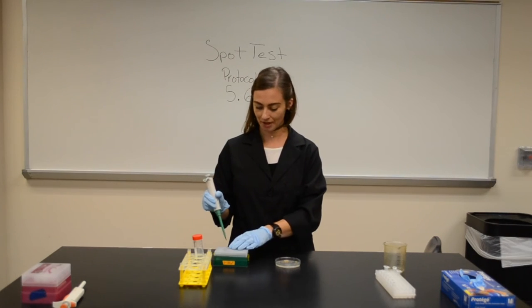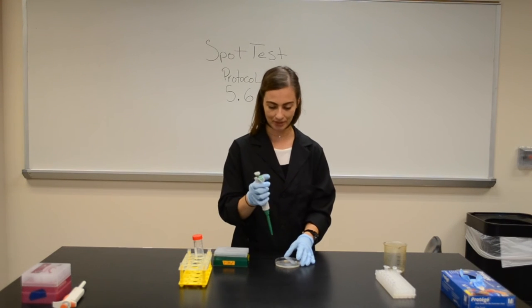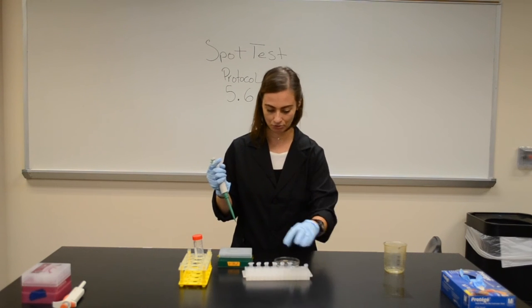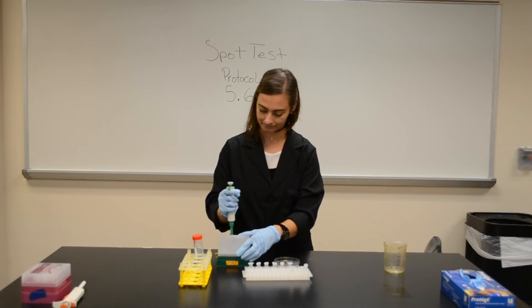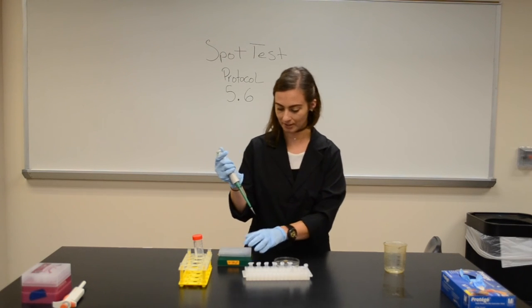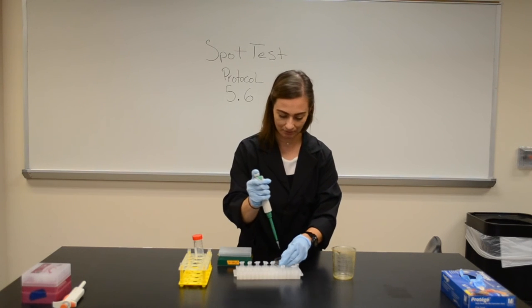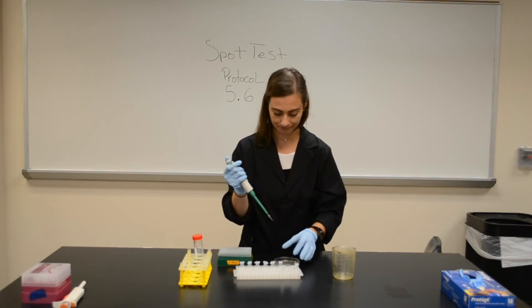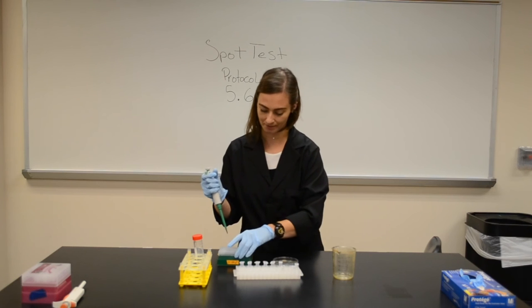As I said, we take our micropipetter, we take three microliters, and place a spot right where I labeled 'soil'. I'm just going to quickly finish my spot plate. I have my container for garbage. I take 10 to the minus one — three microliters — barely lift up the lid, place it, and change my tip.